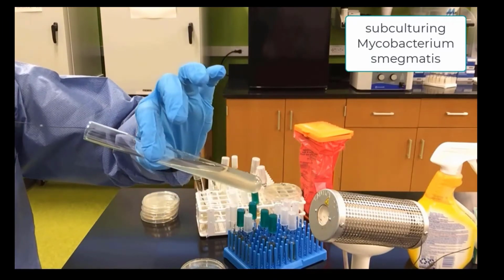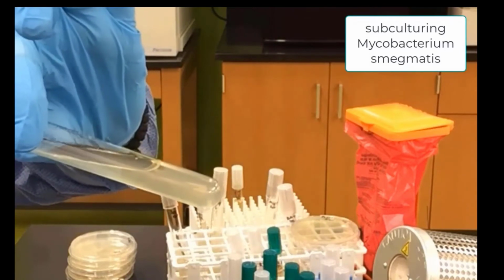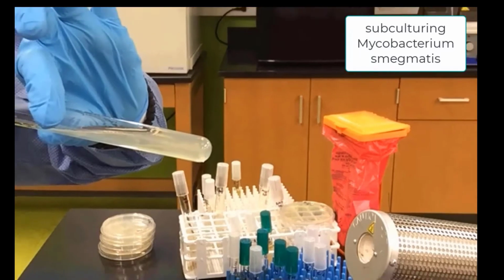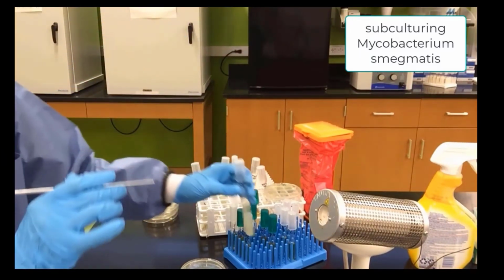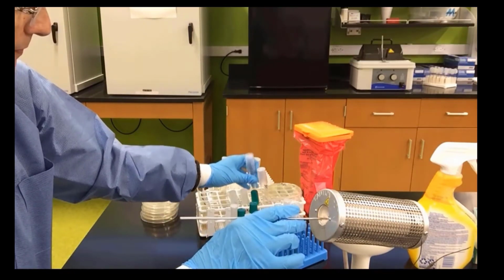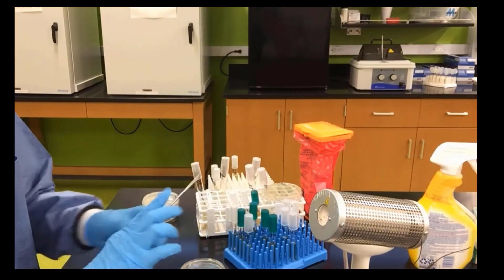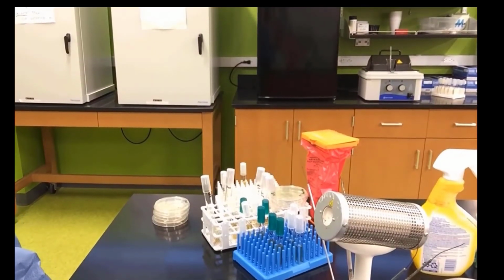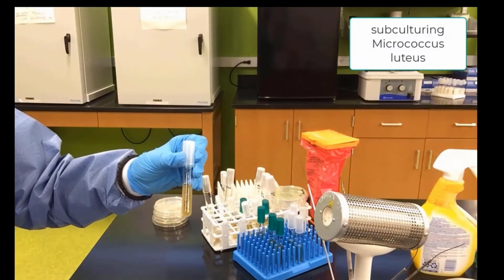Again, we go to the bottom of the slant, we touch the surface, we don't pierce the agar, and we zigzag out of the agar slant, touching the surface only. Sterilize our needle. And now we have completed the subculturing of Mycobacterium smegmatis. We move on to our third bacterium and repeat the process.